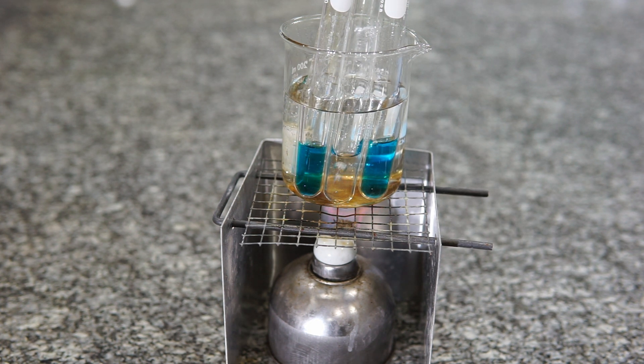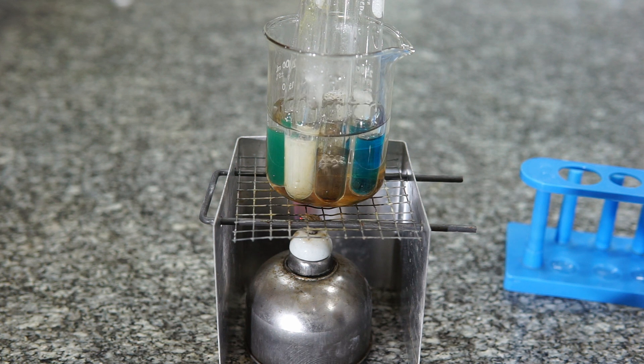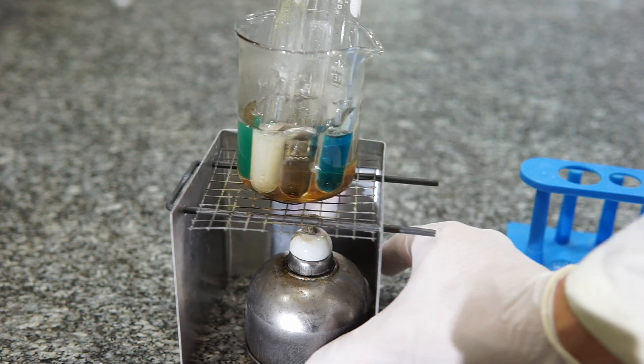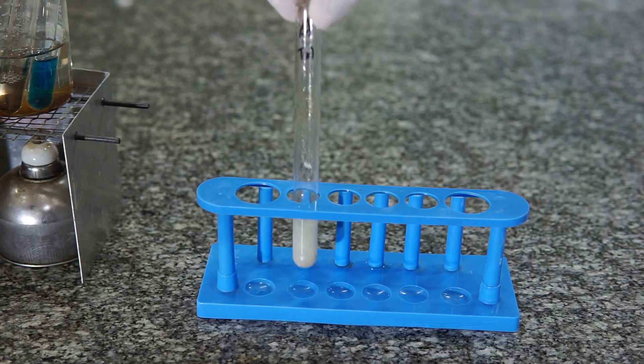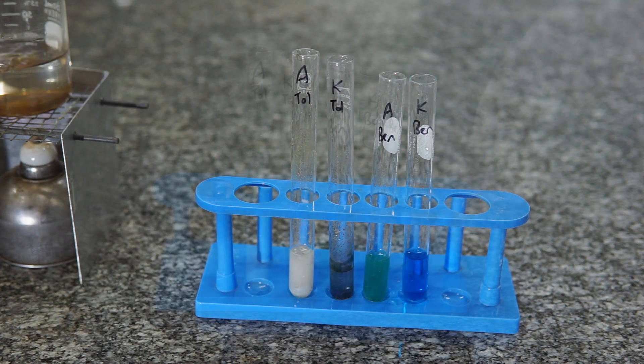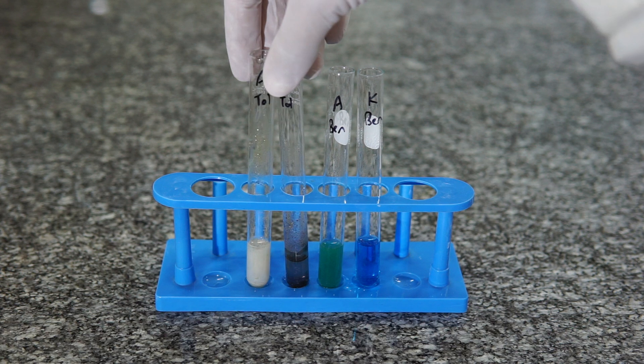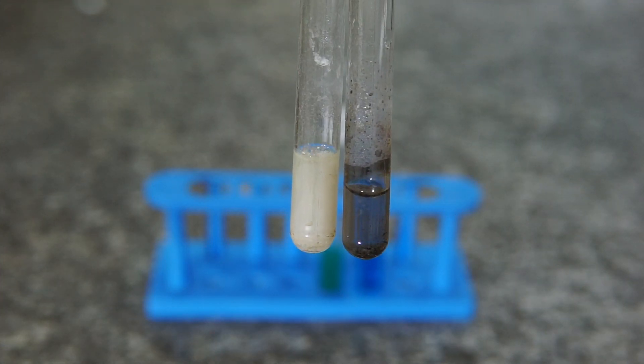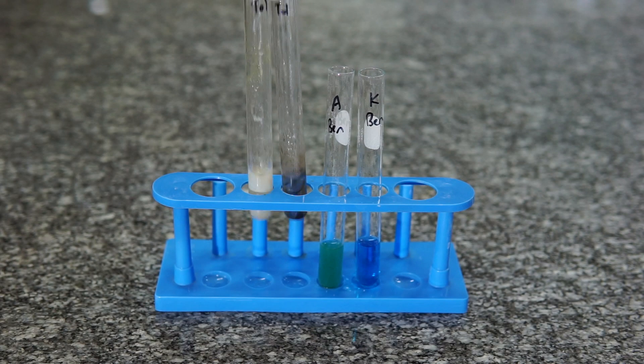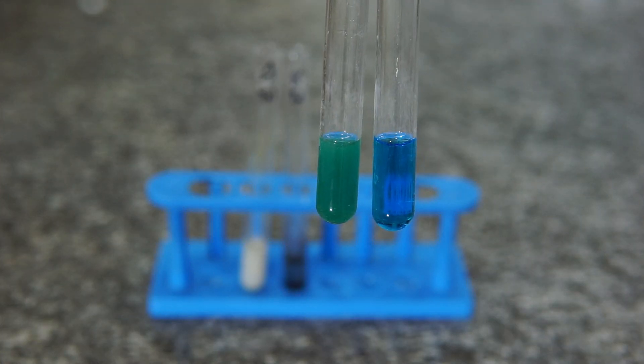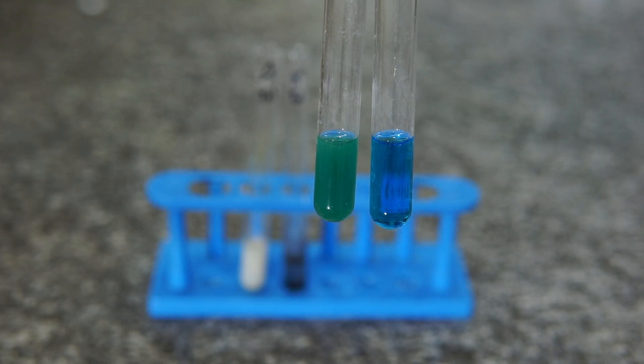In fact, here we have some footage which shows you that the Benedict solution has finally started reacting. That's partly because off-screen I actually added some of the components of the Benedict solution back in and then put it on to heat some more. So we actually did get a positive result with that. And there's the final result with regards to the Benedict solution. It wasn't reacting in the time frame on the video I showed here because there was something missing, some component missing. I added some of the components back into the Benedict solution in the tubes.